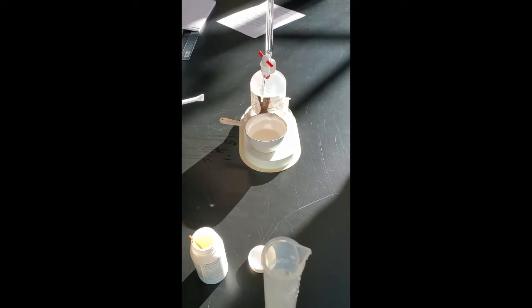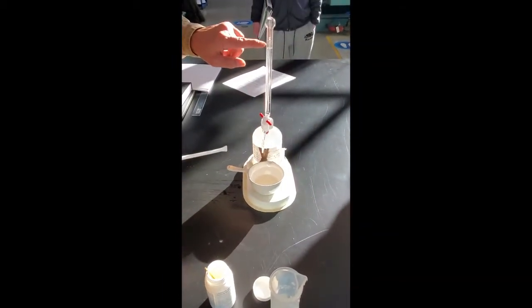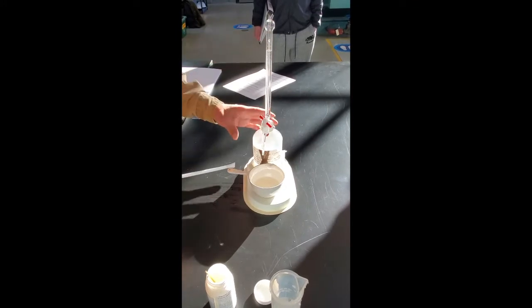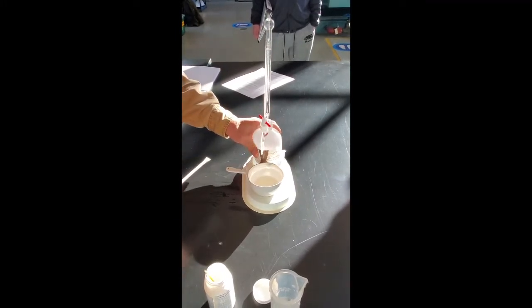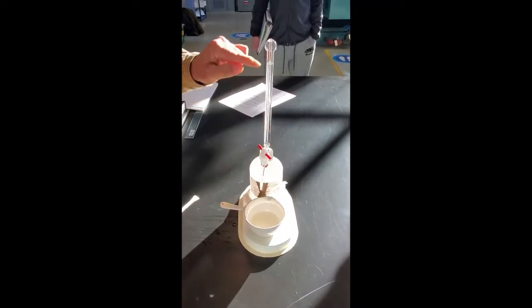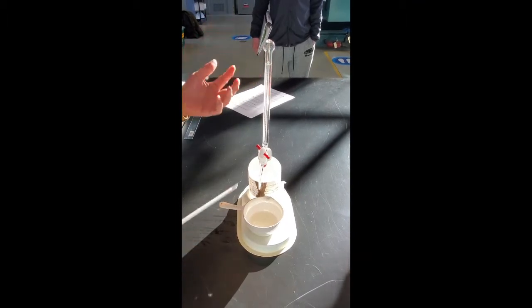So the first thing, right now it's not at zero. We have to make it zero first. So what you do, you squeeze it up a little bit and let it go, drop down to zero, and then we start the titration.